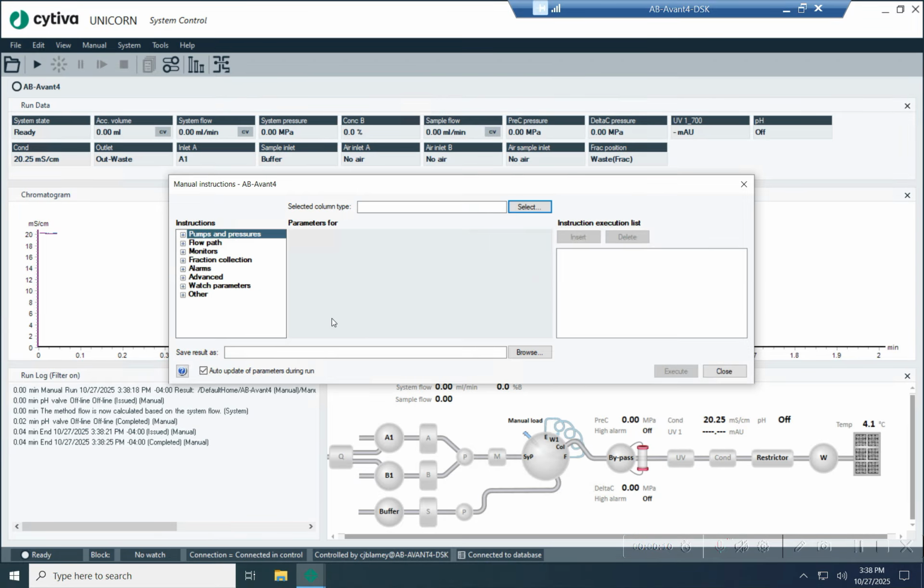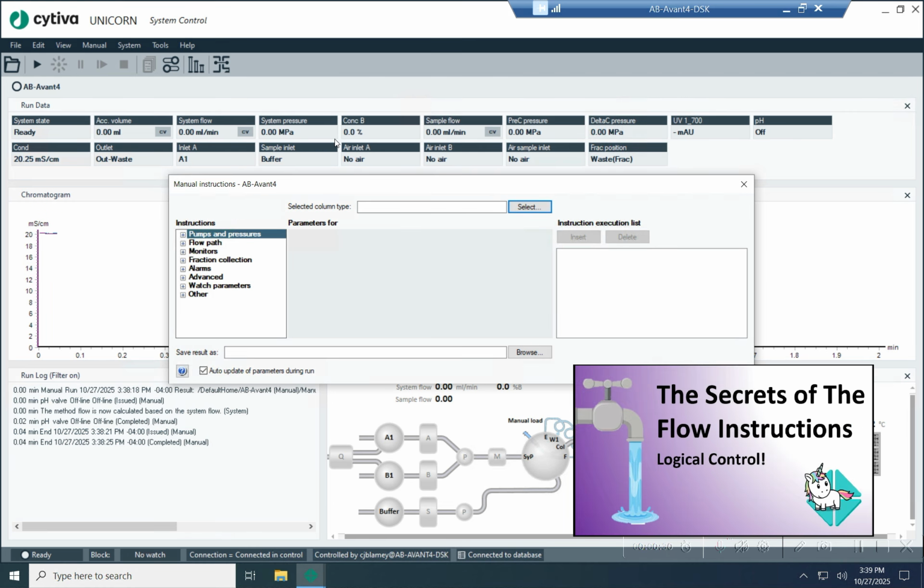All right, I just wanted to show you one more thing, which is how an alarm setting can affect the flow rate. What I can do is adjust the flow rate automatically depending upon whatever the alarm is currently set to. You do this using something called pressure control. I actually made an entire video about this, and I'll link that below. But basically there's a feedback mechanism between the pressure you're currently reading and the target flow rate.